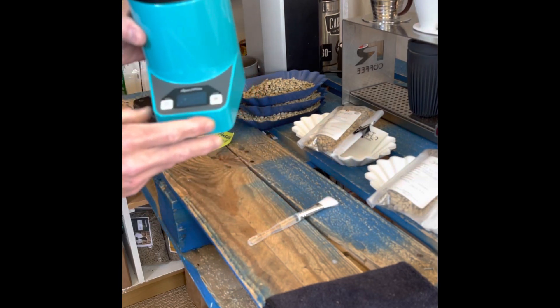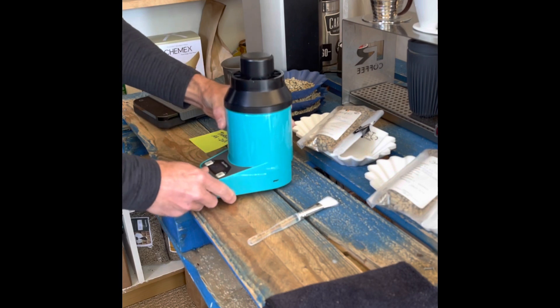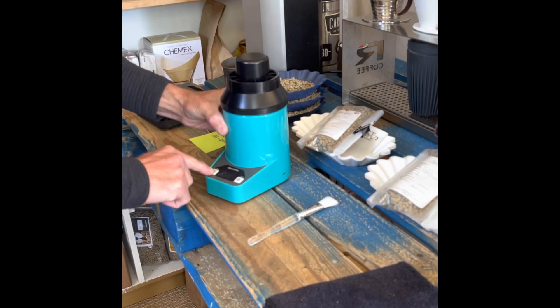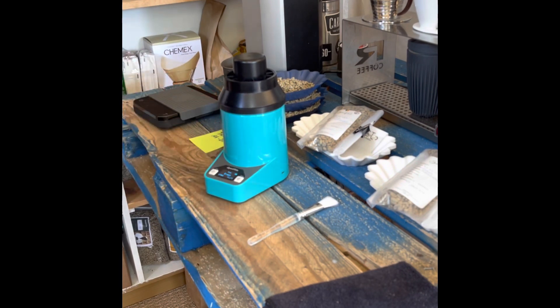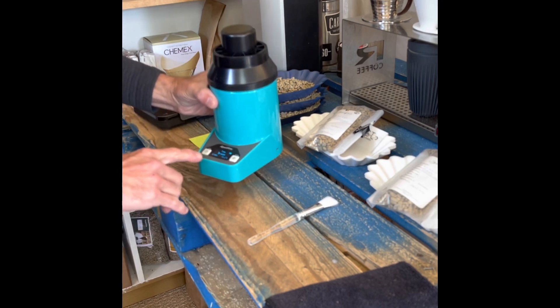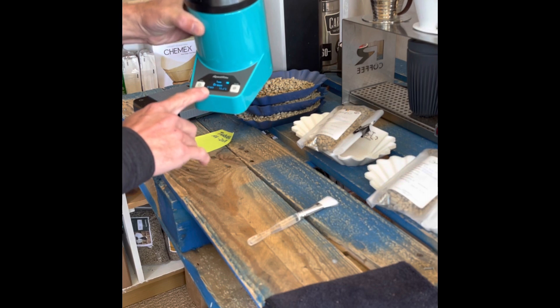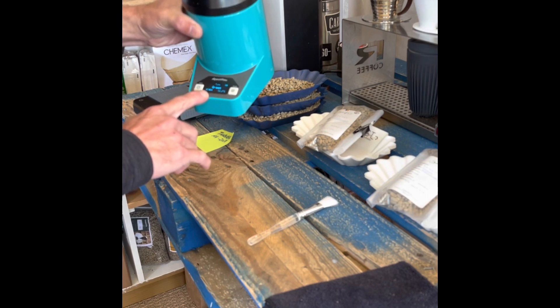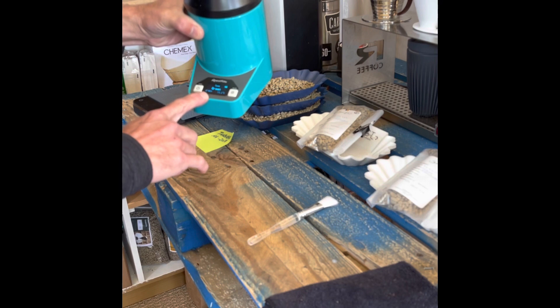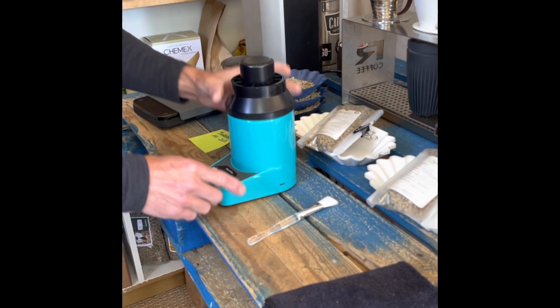Right now the machine is sleeping — it's got some cute little Z's going on. I'm going to hit Enter to wake it up. The type is set to green. We have a relative humidity reading here: it's kind of dry today, 47% relative humidity and 13.2 degrees Celsius. I have this machine set to Celsius.